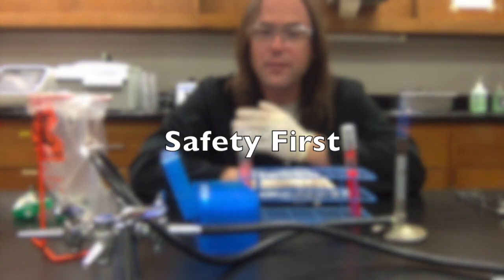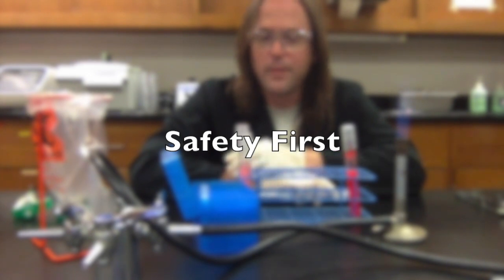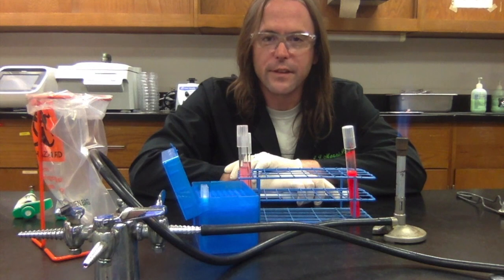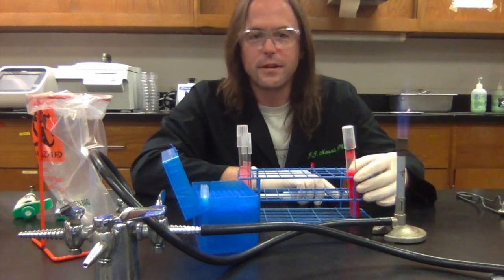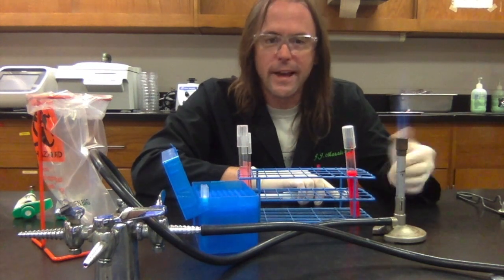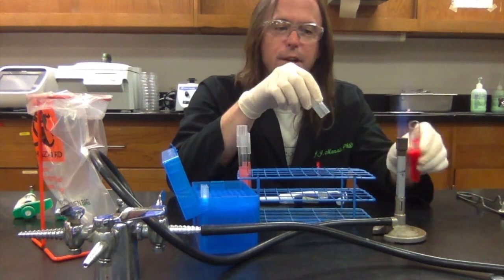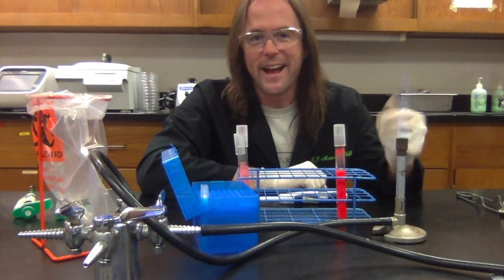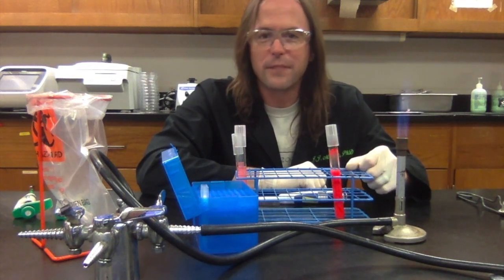Okay, so we saw the right way to use a micropipetter. There are a few things to keep in mind safety-wise when you're working with one of these devices. The first one, of course, is that we're working in the presence of a flame. So whenever you're passing things through the flame, you want to make sure that you don't pass your hand through the flame. That can be pretty unpleasant.